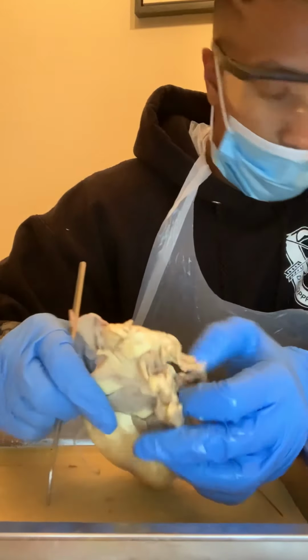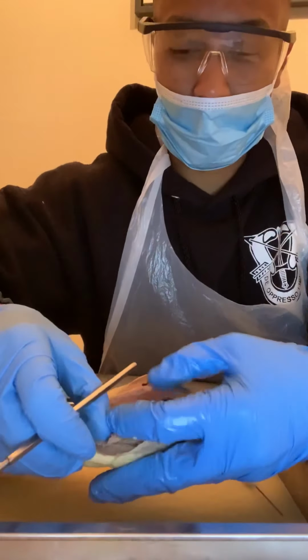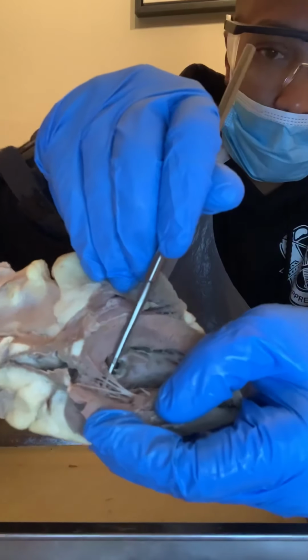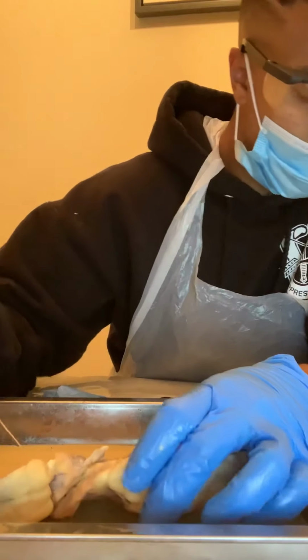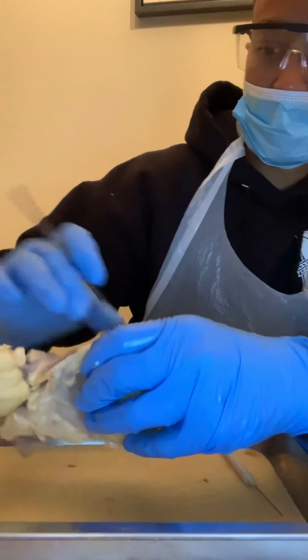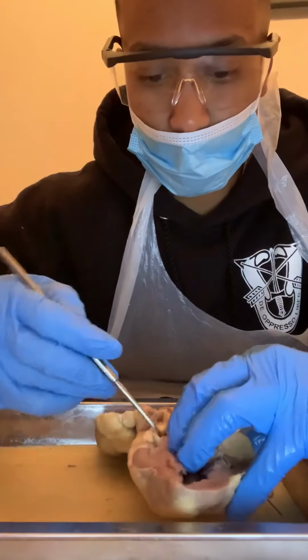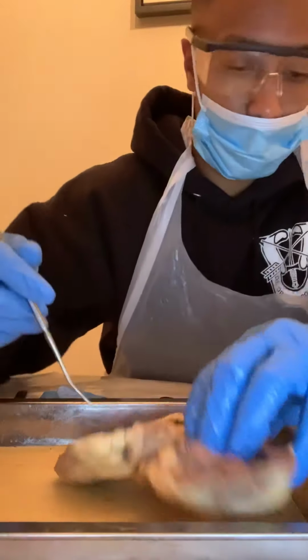And then we have the tricuspid valve. All right, so the tricuspid valve, I had to cut away a little bit so you could see it better. The tricuspid valve is those stringy-like things right there. Those string things right there. And then the pulmonary semilunar valve is going to actually be right in here, up in this portion. I know it's kind of hard to see, but I didn't want to cut up too much, but it's right up in this area. That should be your pulmonary semilunar valve.